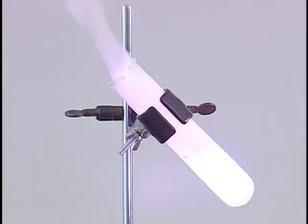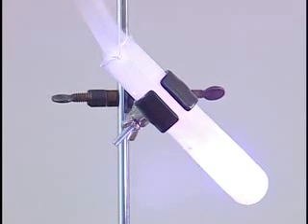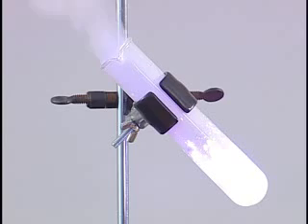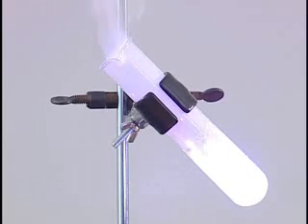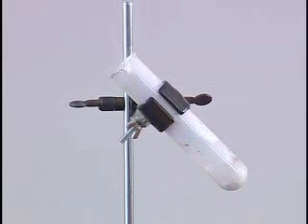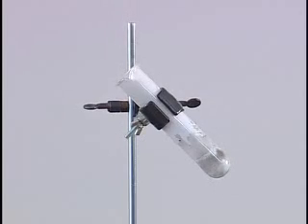Notice all the colors - that's light energy. That's the chemical bond energy being converted to light energy. If I was going to touch it, which I obviously won't do, it's really really hot, so that's heat energy. And notice the substances coming out of the test tube - that's carbon dioxide and water, because that's what happens when the bonds of glucose and respiration are broken down.